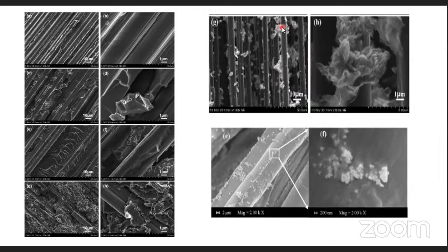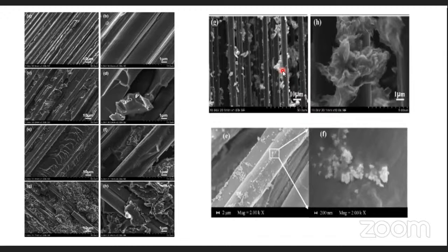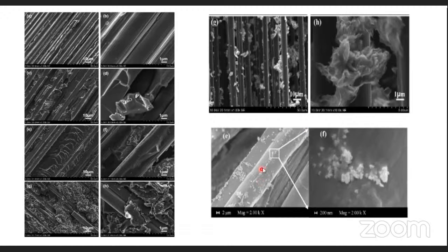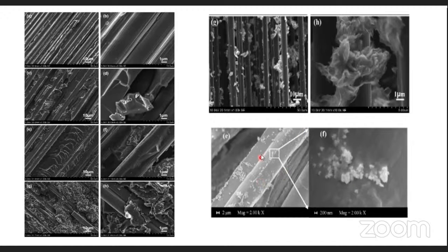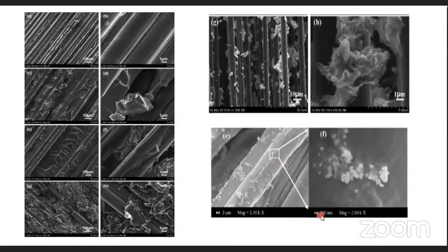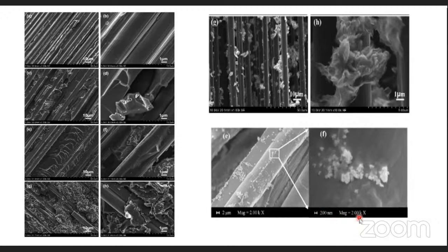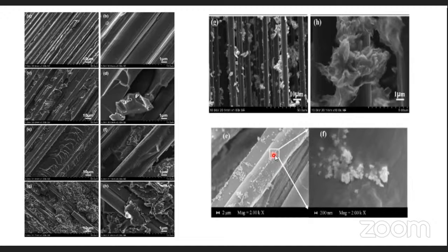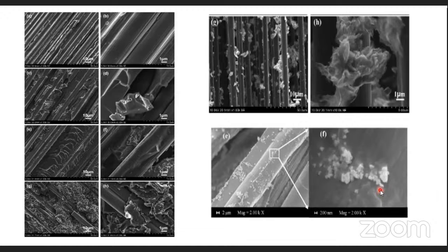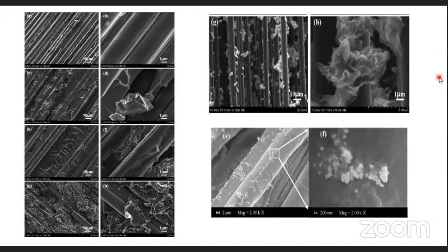We took images in our own instrument — carbon fiber over which we have graphene or graphene oxide particles, and titanium oxide nanoparticles over glass or carbon fiber. When magnified further to a scale of 200 nm at 2,000x, you get a very beautiful image showing how the nanoparticles are placed over the fiber. Scanning electron microscopy allows you to understand these structures easily.